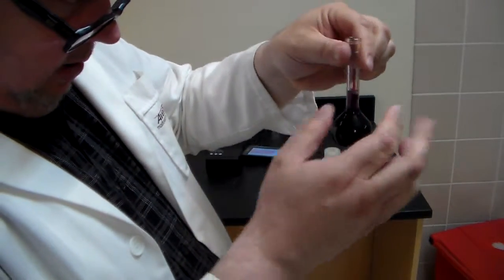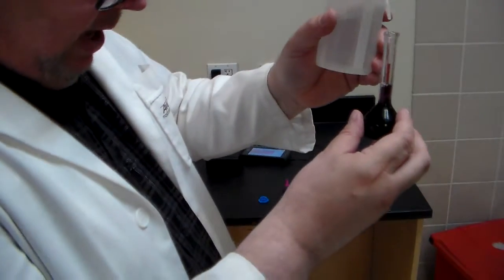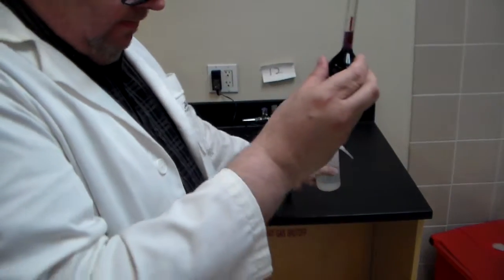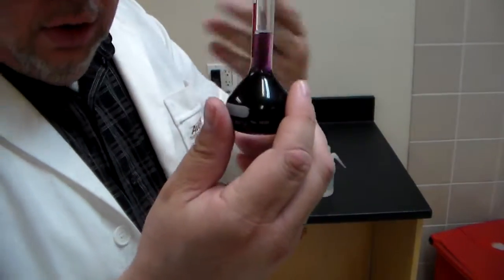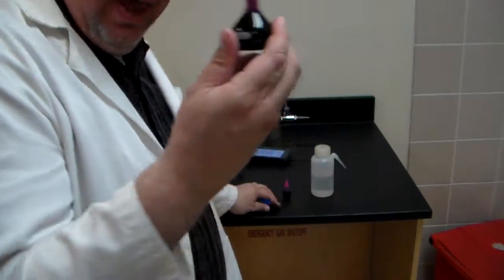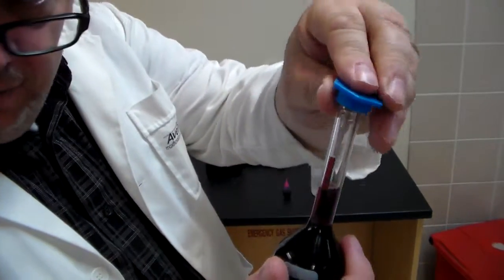Okay? Oh, come on. Get that in there. All right. So I'm going to cheat a little bit. I'm going to slowly add it. I would give you guys a dropper and a little beaker so you can slowly add it, and then pay attention to the top. Once you've got it at the top like this, you take your blue plastic and cover it like this.